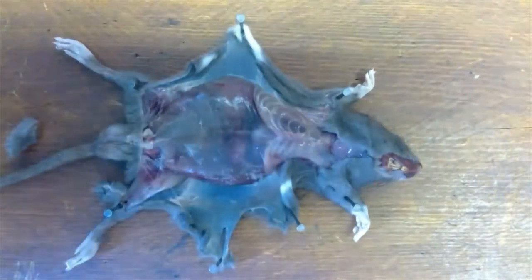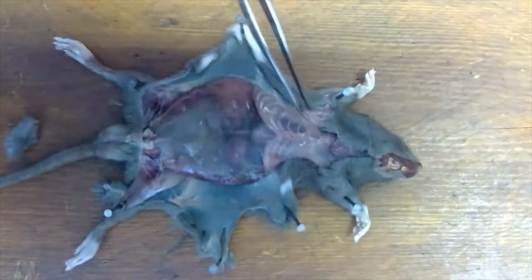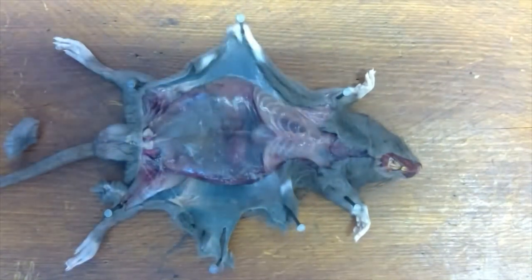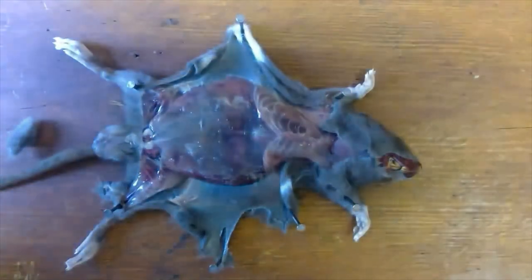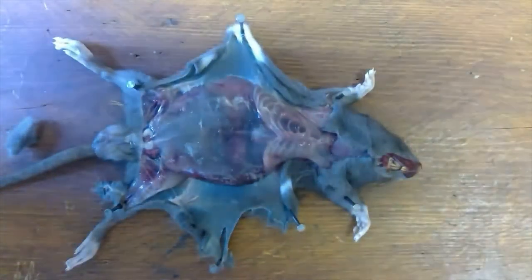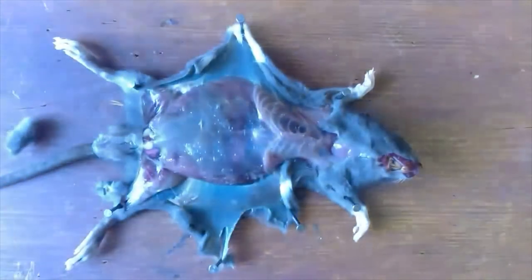I'm going to move over to my friend Manly Stanley, my torso model. We can have a look at what it looks like in a human, which will allow us to follow the dissection.